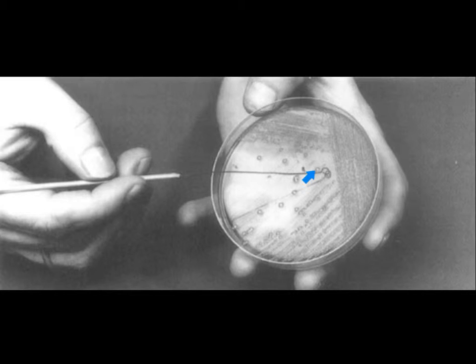So here we are touching our single bacteria colony and we're going to transfer this to our water drop on our slide and we want to mix it up well. By doing this, we're taking that thick amount of lots of bacteria and we're diluting it down with the water.